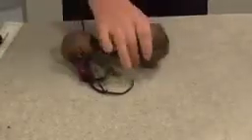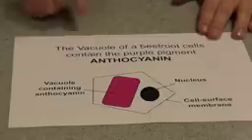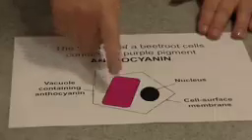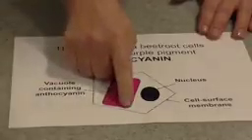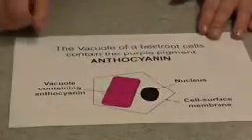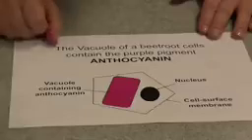Now, the reason we're using beetroot is that beetroot cells contain a red compound called anthocyanin. It's a sort of purpley red colour. It's what gives beetroot its lovely colour. The anthocyanin is contained within the vacuole of the beetroot cell. So in order to escape from the cell, the anthocyanin must first pass through the membrane of the vacuole, in other words the tonoplast, and then through the cell surface membrane. In a normal healthy beetroot cell, this can't happen because anthocyanin is quite a large molecule. It's unable to escape through the membrane.